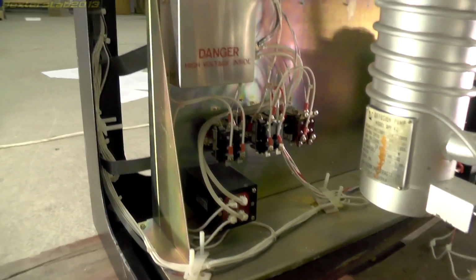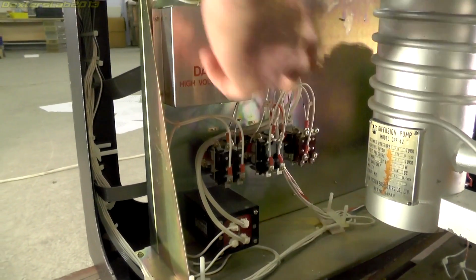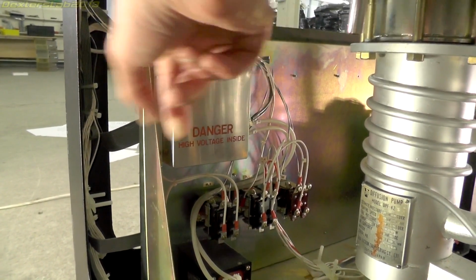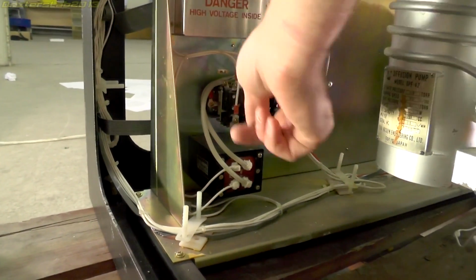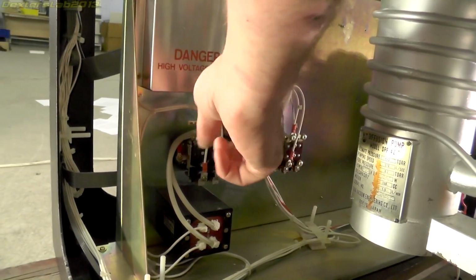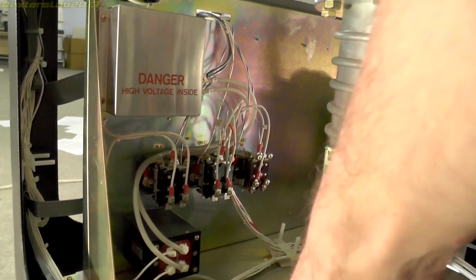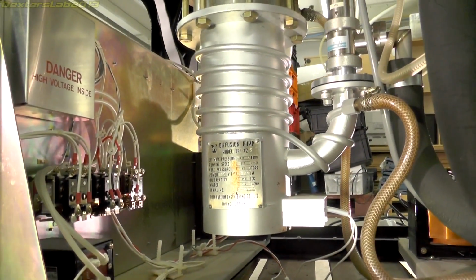Just on the inside there, we've got a number of high voltage devices. I think they might be power supplies for the penning gauge, the penning vacuum gauge. And there's a number of relays just here. Interestingly, these are all open, don't have any sort of frame or anything on them. So I'm not quite sure what voltage they're switching, but you probably don't want to stick your hands in here when it's switched on. You can see there the diffusion pump.